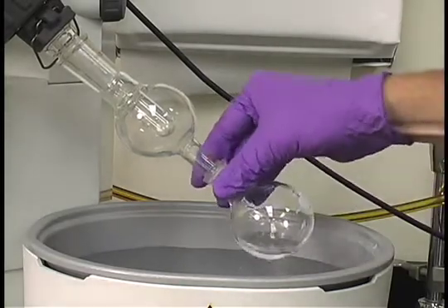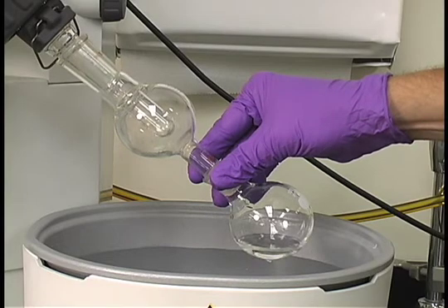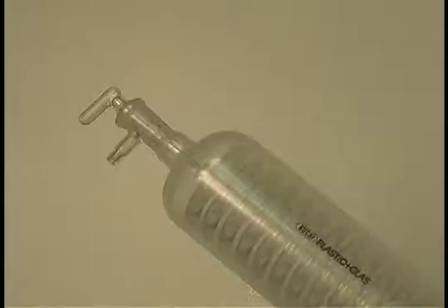The flask is then attached to the rotary evaporator and the stopcock closed to complete the vacuum.